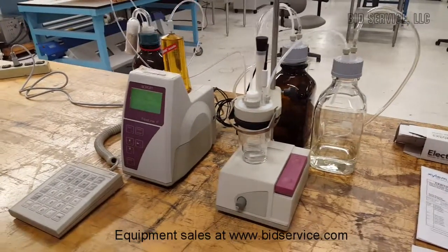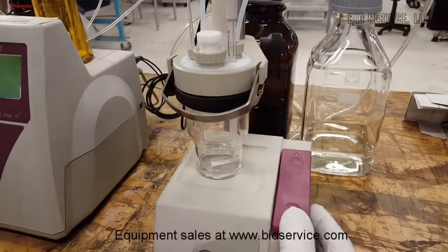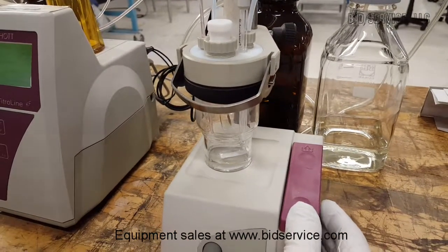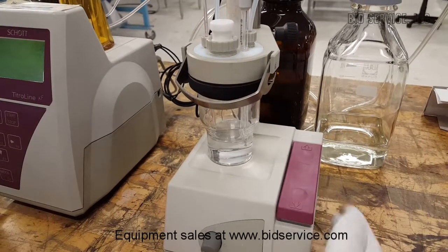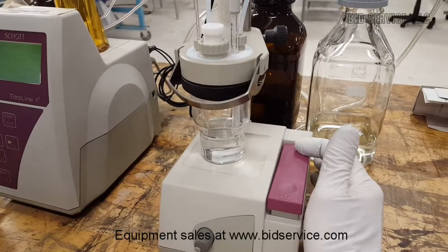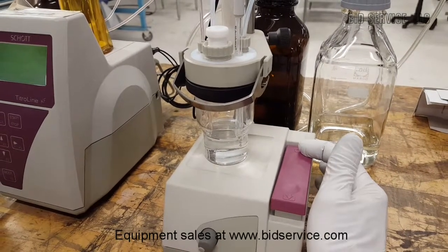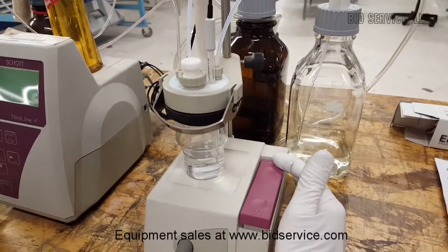What I want to do first is add some solvent — I'll tell you that we can add some solvent. Right now I just have DI water in the system. You can see we're adding solvent and we can also reduce some of it into the waste bottle. You can see that is operational. I'll reduce it down a little bit.